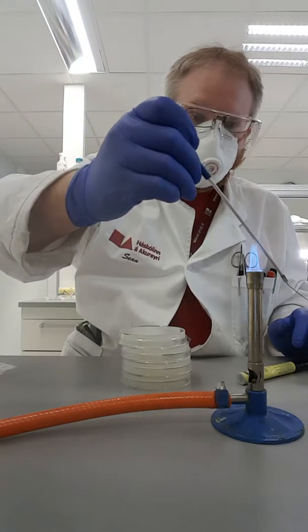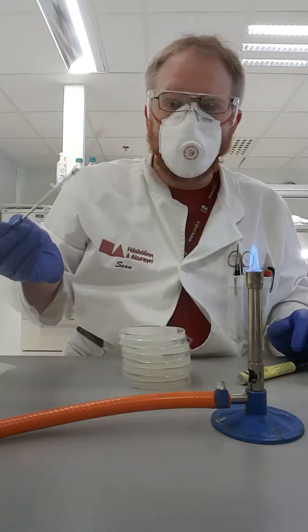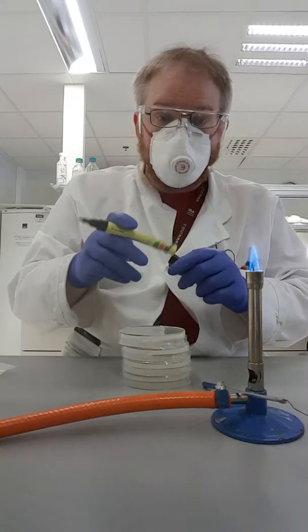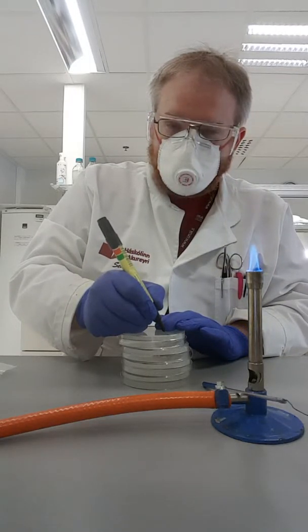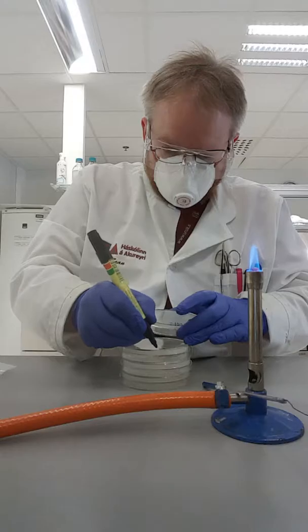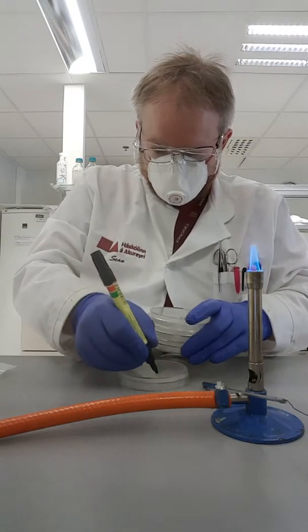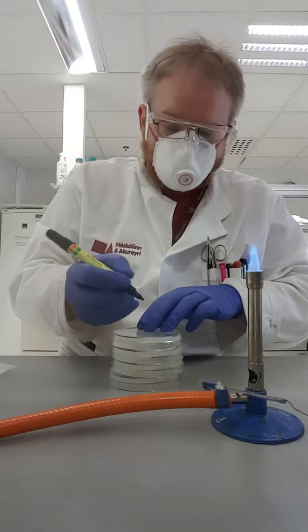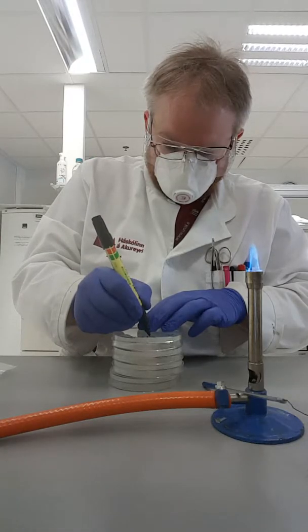So now that should be free of any bacteria or fungus or anything weird like that. I'm just going to put that there and I'm also going to label some of these petri dishes with today, which is the 19th of March. I'm also going to put on here what I think it is — so this is some sort of soy milk yeast.